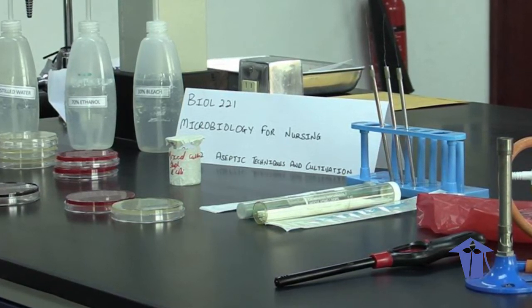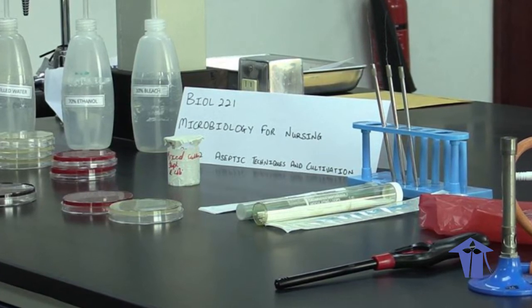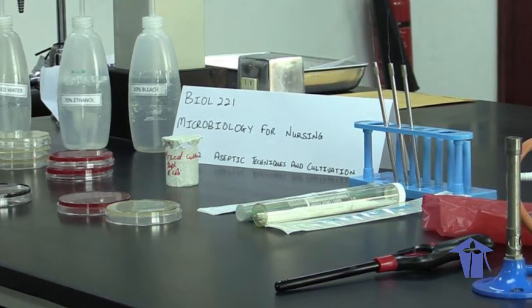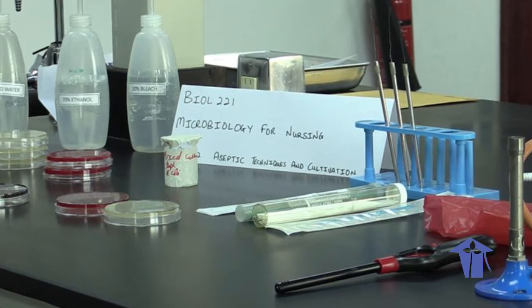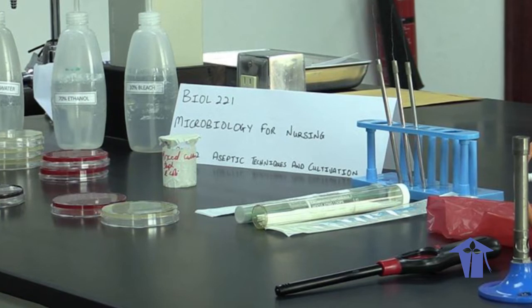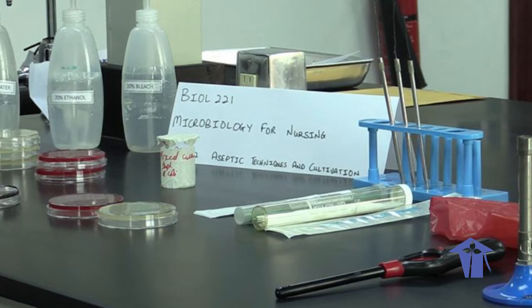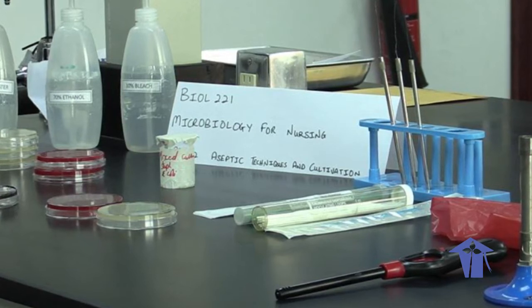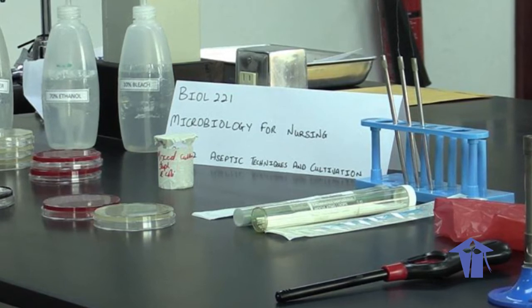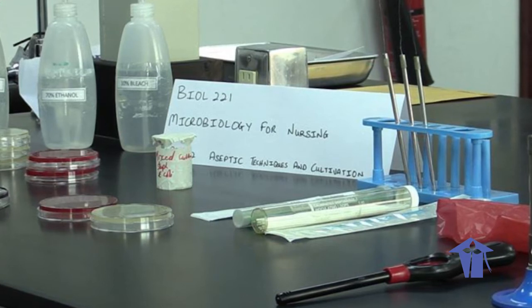Using aseptic techniques, we try to achieve a pure culture. A pure culture is composed of only one kind of microorganism. Occasionally, a mixed culture is used — in a mixed culture, there are two or more organisms that have distinct characteristics and can be separated easily, either from morphological characteristics or from their genetic composition. In either situation, the organisms can be identified. When unwanted organisms are introduced into the culture, they are known as contaminants.